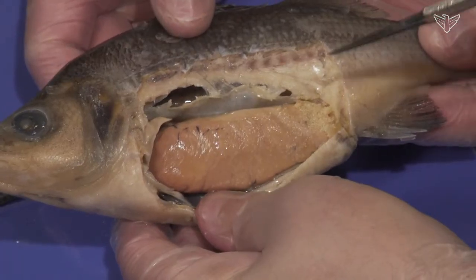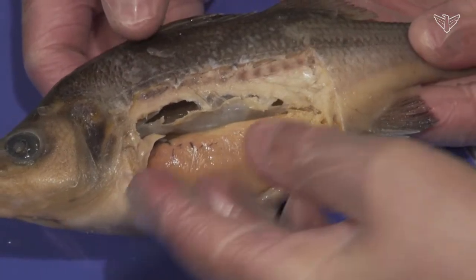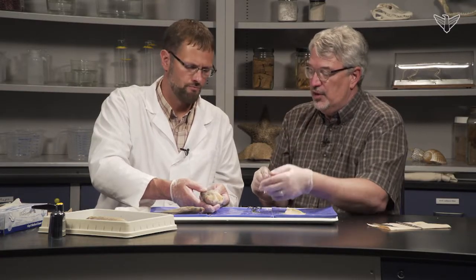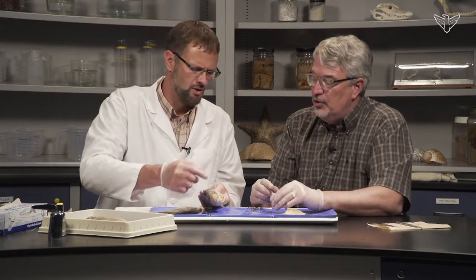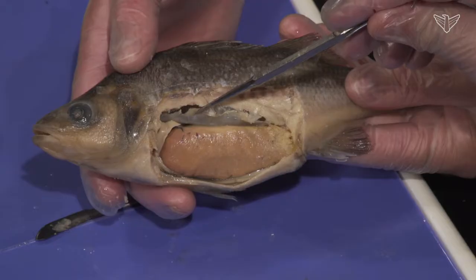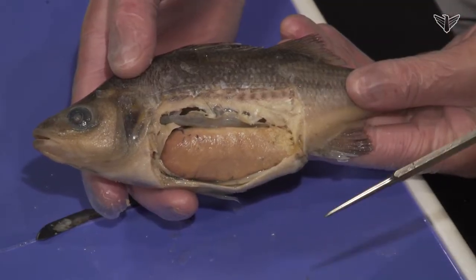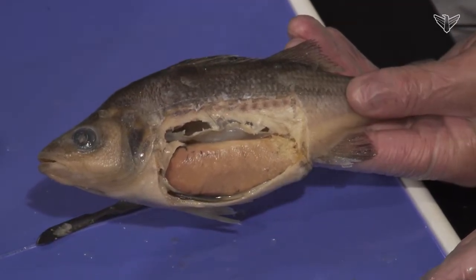Right up here is a very important structure — you can see it's a balloon-like bag of air. That's the swim bladder. Swim bladders are a really important evolutionary adaptation in these ray-finned fish because it gives them buoyancy — just like having an inner tube around yourself, it helps you suspend yourself in the water. They maintain their level of depth in the water without sinking to the bottom. These ray-finned fish have no external connection to swallow air; instead it's all through blood vessels, and they can regulate buoyancy by releasing gas from their blood vessels and pulling it back in.